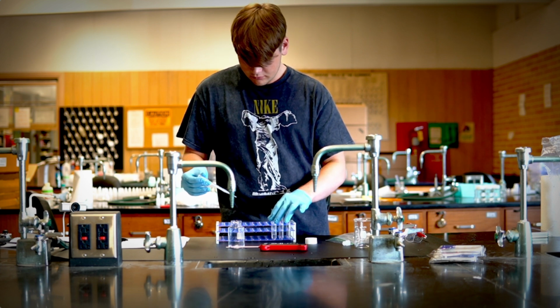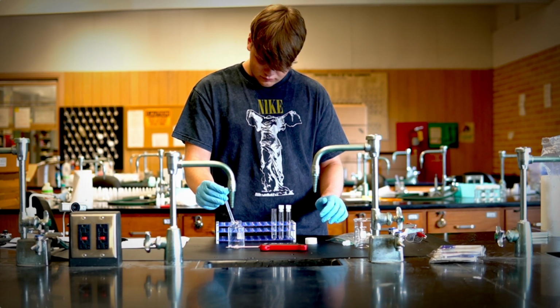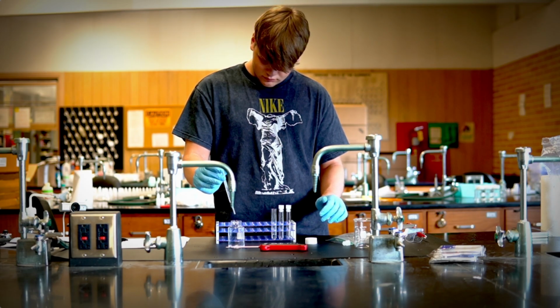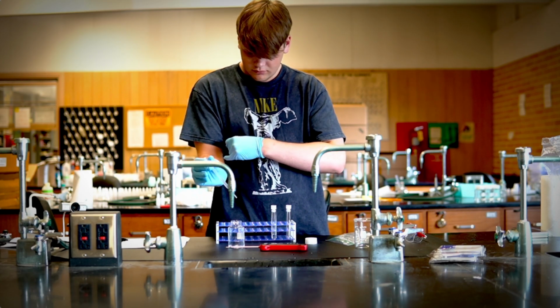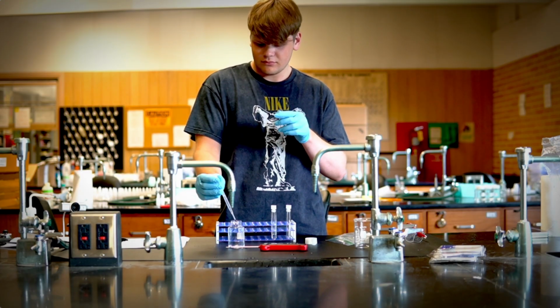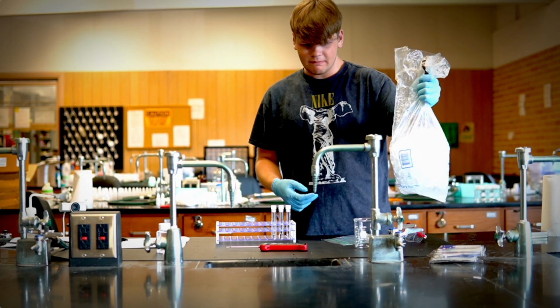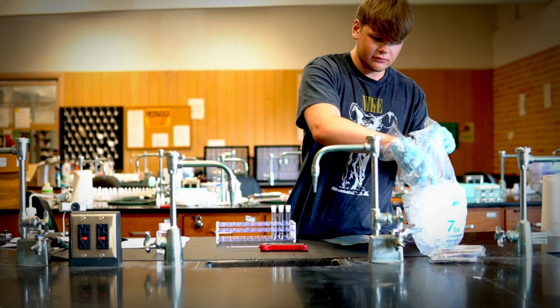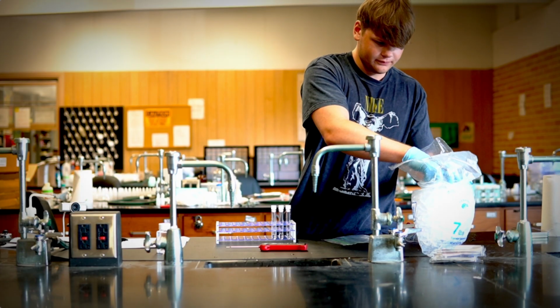Start by putting 1 ml of pure water into 3 tubes. You can measure the 1 ml using your pipette, or you can just add about 25 drops, as long as you have the same volume of 1 ml in all of the tubes. You should be good. After you fill all the tubes, you're then going to put your ice into the beaker. So we're just going to put some ice into the beaker.